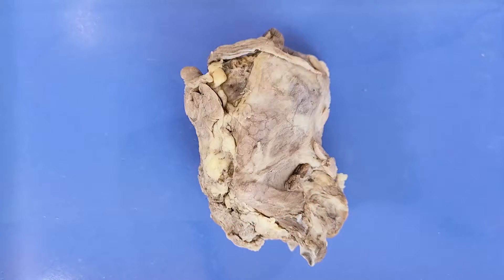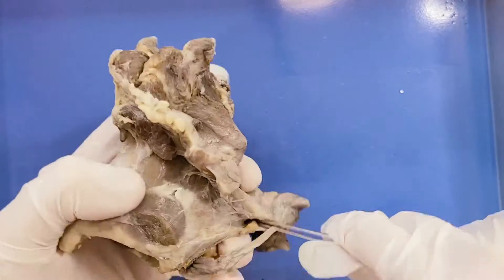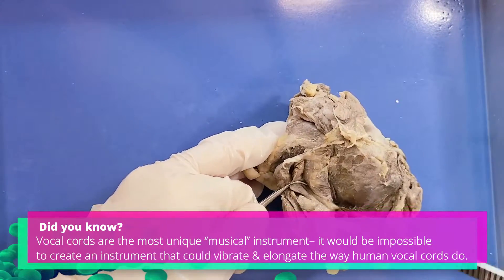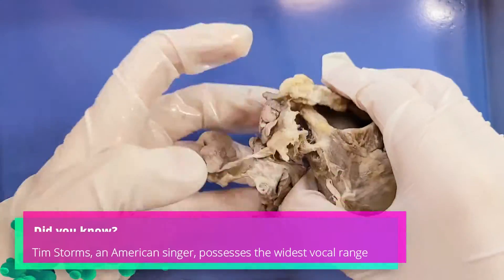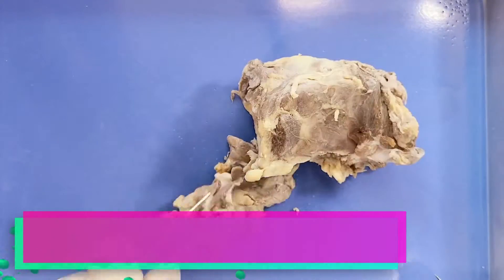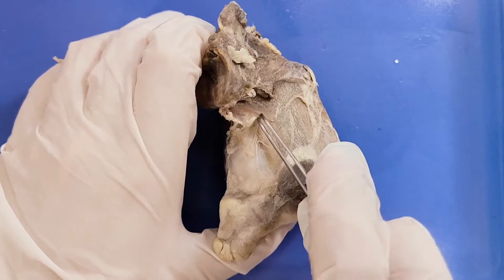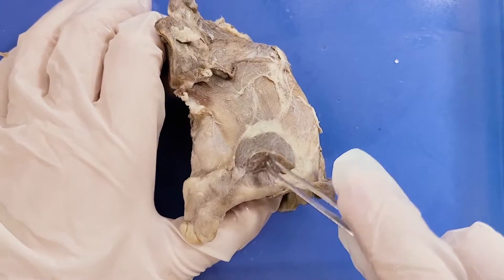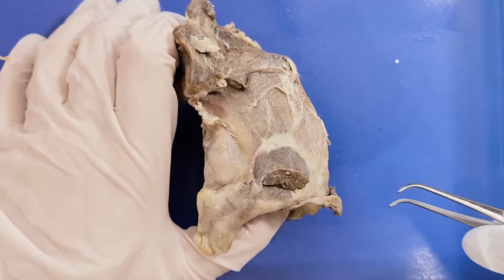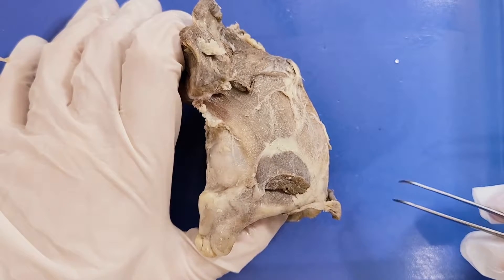Now let's take a look at the external anatomy. I'm going to cut away all the extra fat and muscle tissue around the larynx so we can see the structures better. Here around the larynx you can see these muscle fibers attached to it. These muscles are called the laryngeal muscles, which perform two important functions. Some laryngeal muscles act to move the larynx up and down during swallowing, while other laryngeal muscles act to lengthen or tense the vocal cords, controlling sound production.